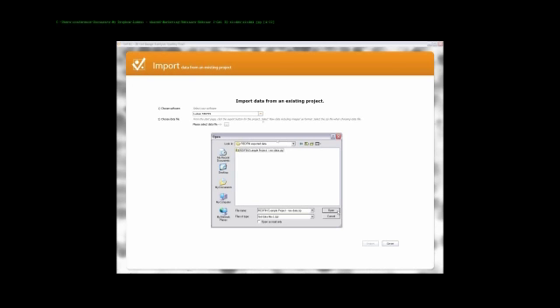So here from Redfin it says, from the start page, click the export button of the project. Select raw data including images, and so on. If you select a different software, there will be a different instruction, giving you a one-sentence instruction on how to export data from that particular software package. When you've done that, you click Please Select Data File. That opens up a browser window that you recognize from other computer environments. You basically browse to the place on your hard drive where you have the zip file with all the data and the images. You select that, and you click Open. And that will then take you to the import process of the data.